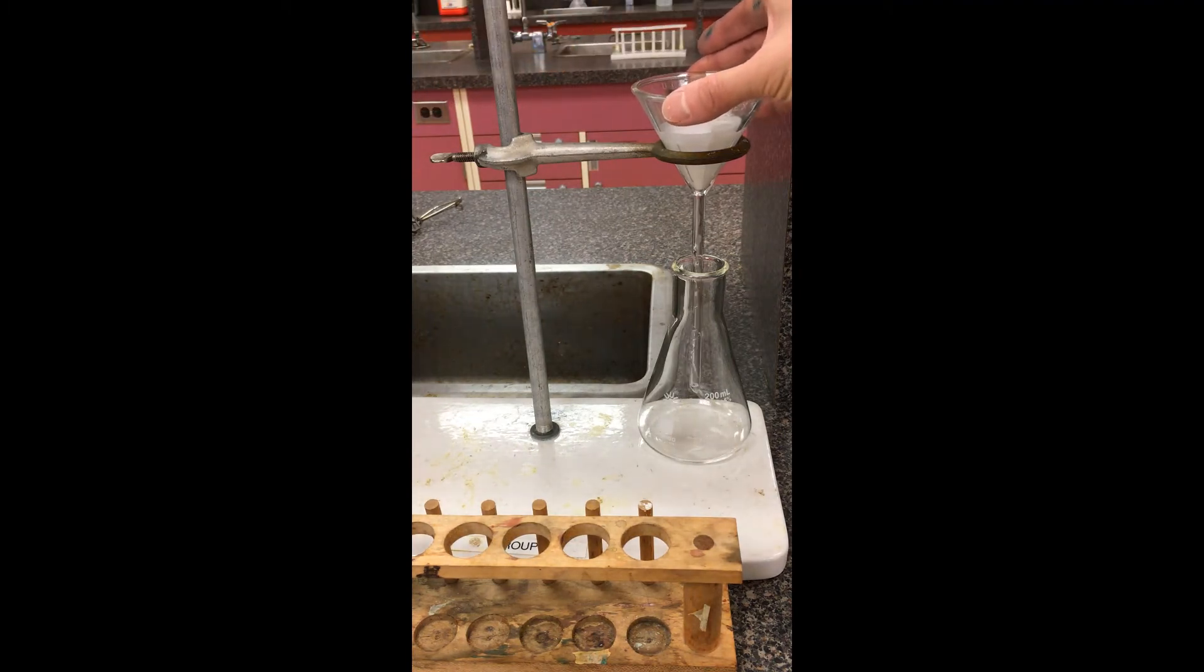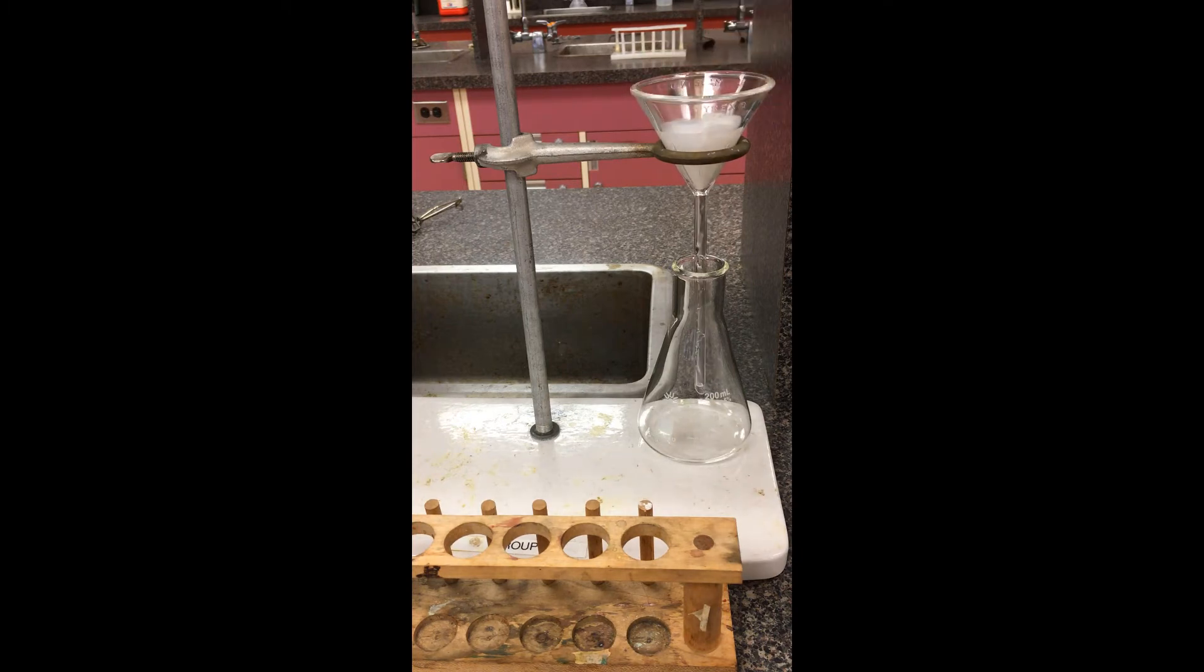Depending on the size of the filter paper here, the funnel that you're using, it may take more or less time for the water to actually get its way through. But you already see that the water is really dripping through here. Eventually the solid will be collected here.